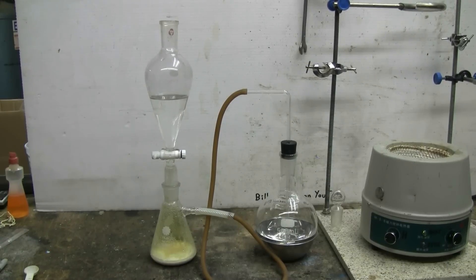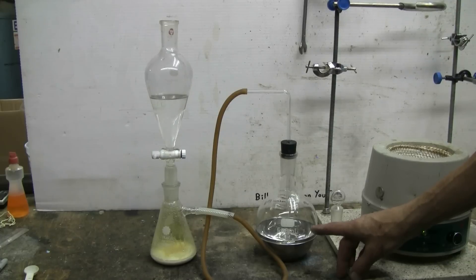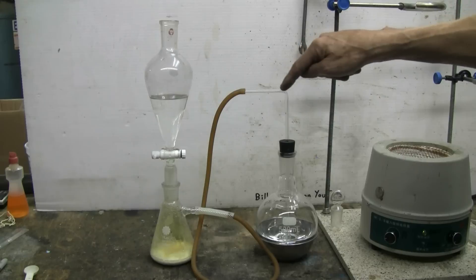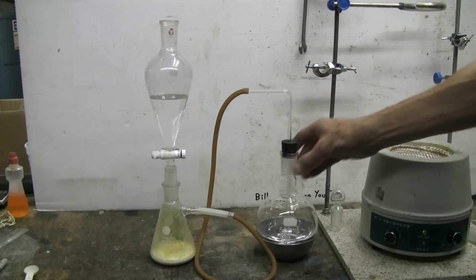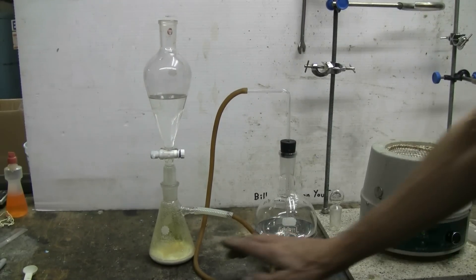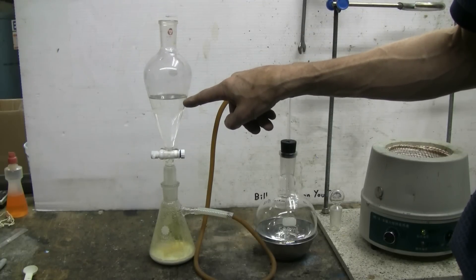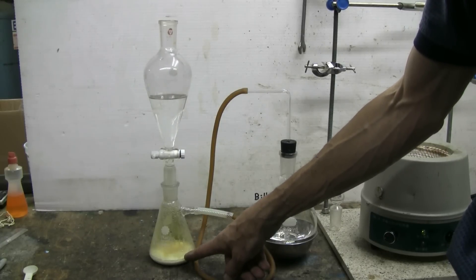Here's the setup for the first step of making bromine. About a third full 500 milliliter round bottom boiling flask, a third full of the sodium bromide 35% solution. There's a glass L-tube leading through the rubber stopper and down to the bottom of the flask. The other end is connected to our chlorine gas generator which consists of an Erlenmeyer vacuum flask and a 250 milliliter separatory funnel filled with hydrochloric acid. Some of the calcium hypochlorite has been placed in the bottom of the Erlenmeyer flask.